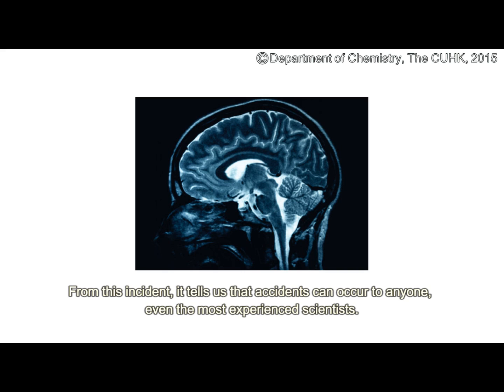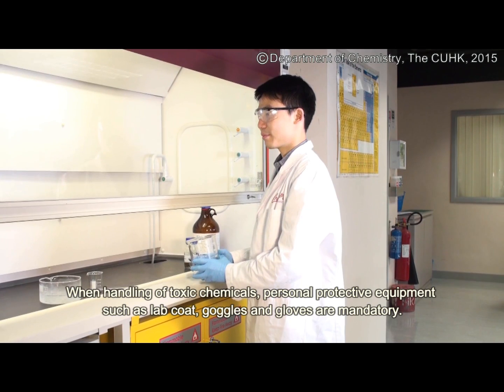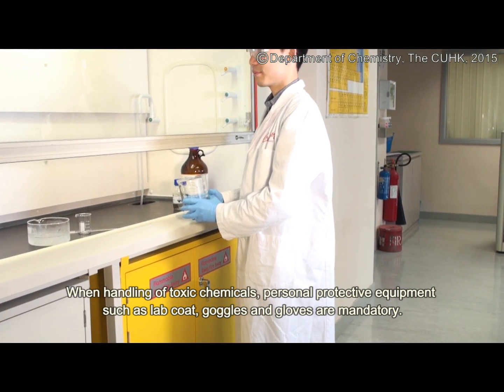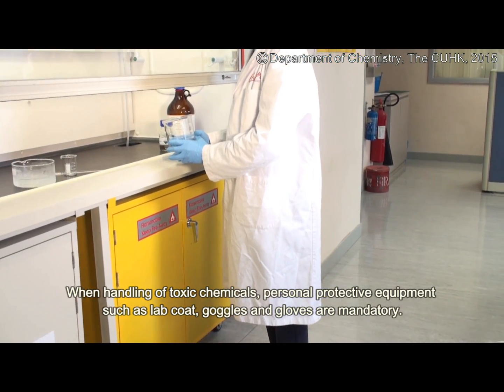From this incident, it tells us that accidents can occur to anyone, even the most experienced scientists. When handling toxic chemicals, personal protective equipment such as lab coats, goggles, and gloves are mandatory.